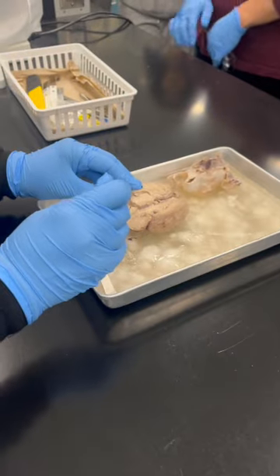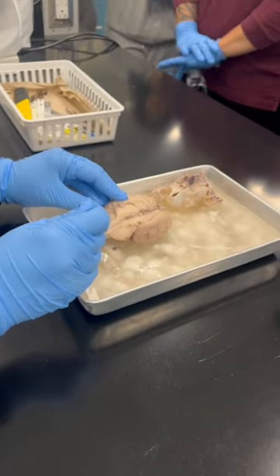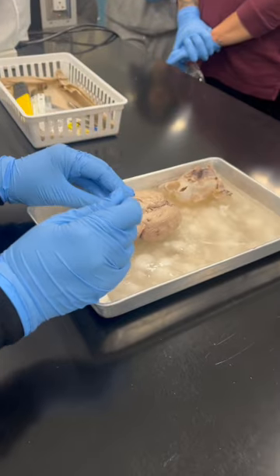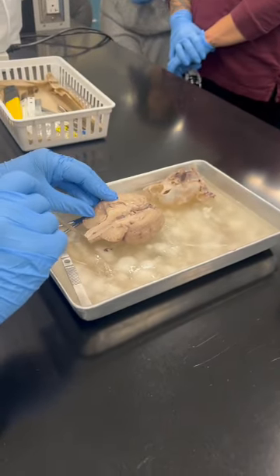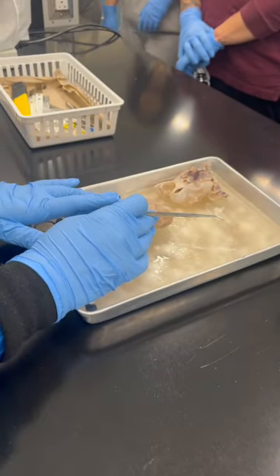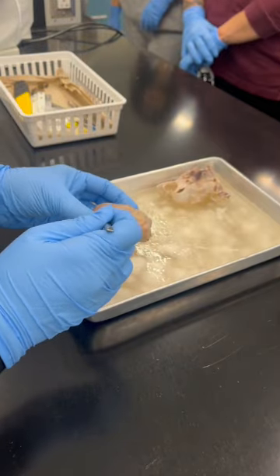Then what else? This is the brainstem: the midbrain over here, the pons, the medulla oblongata, then the spinal cord. What else do we need to know? Anything else? Oh, then this one, the anterior. You can see this brain is not smooth.